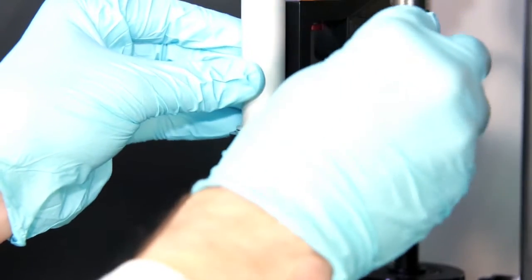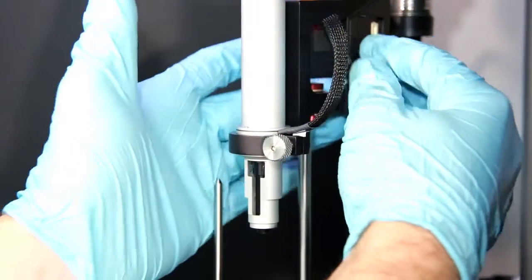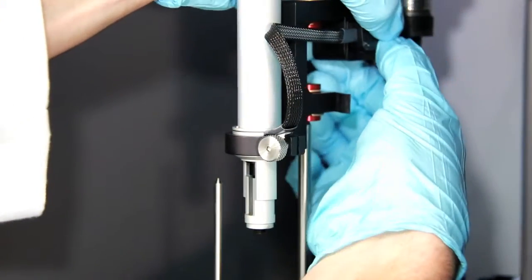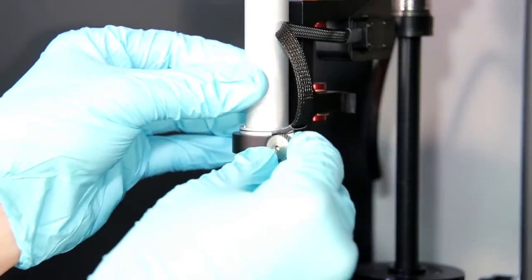To reinstall a pipette, simply place the pipette into the collar, then reattach the cable by applying firm pressure until you hear a click.